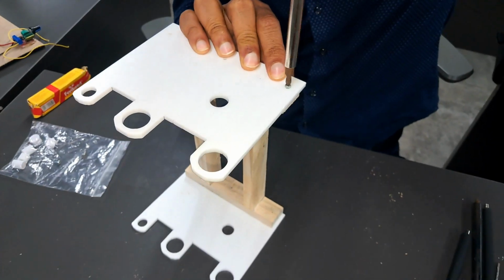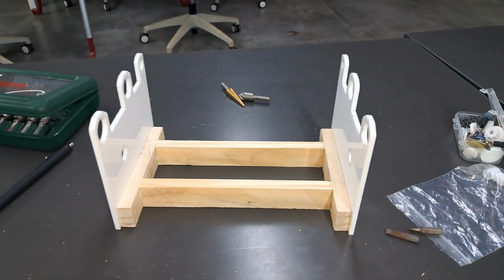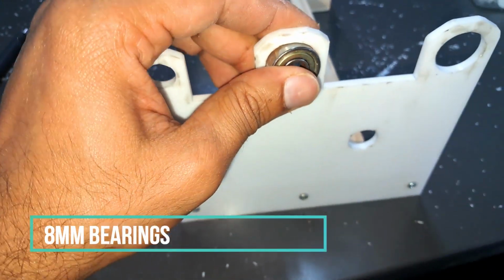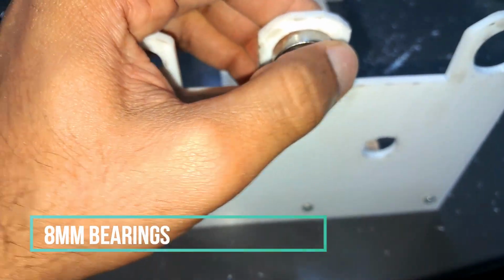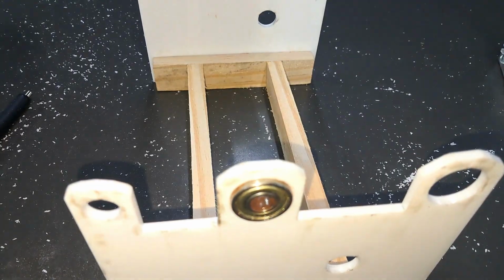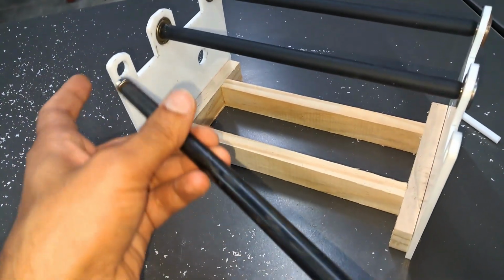After all, I have placed the screws and our frame is ready. Now I am placing the bearings which will hold our rollers for smooth rotations. I have taken these rollers from the printer cartridge.